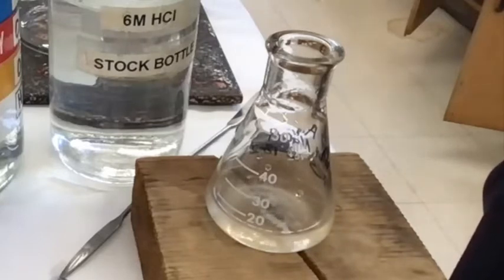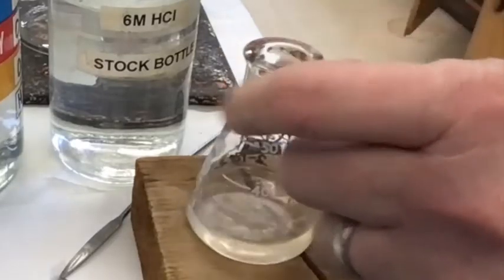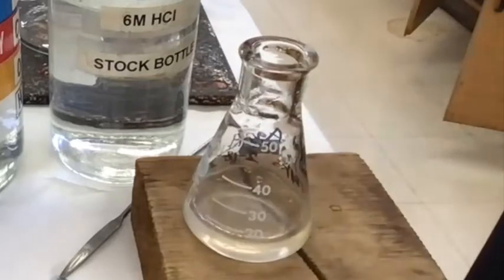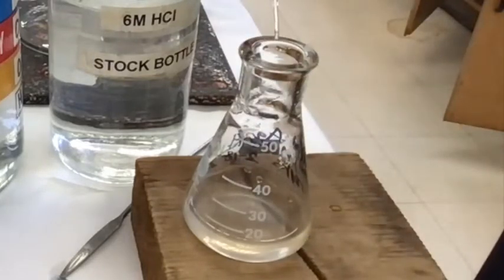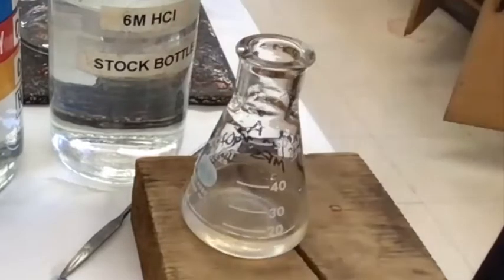Yeah, this is basically like a titration. Yeah, very good, Morgan. This is like a titration. That's basically we have a precipitation indicator. You know, we did titrations and you had color indicators. This is a precipitation indicator. Kind of cool, huh?